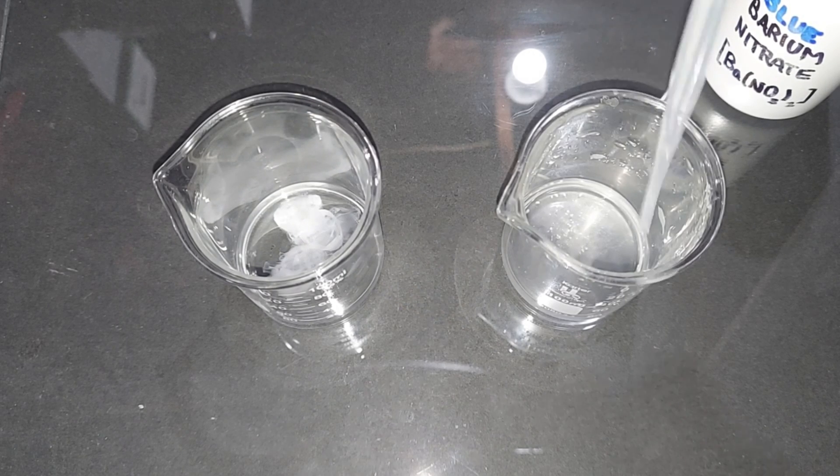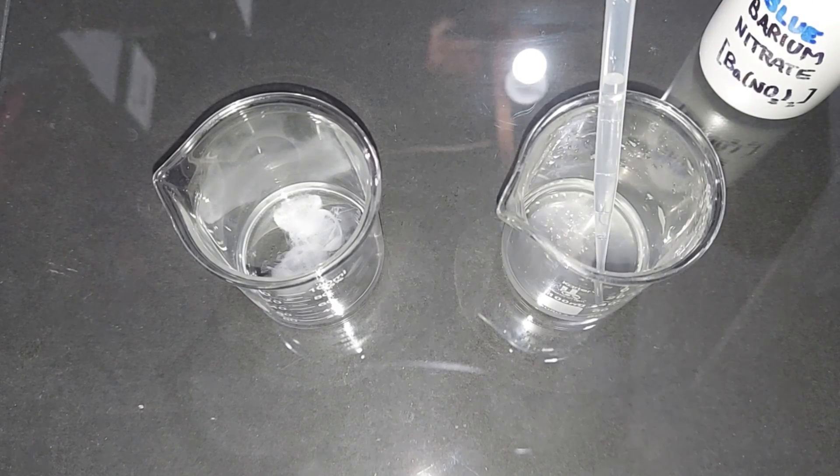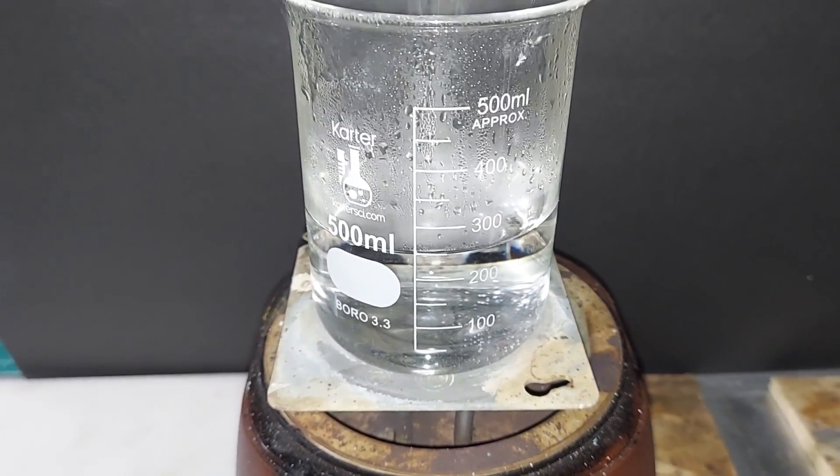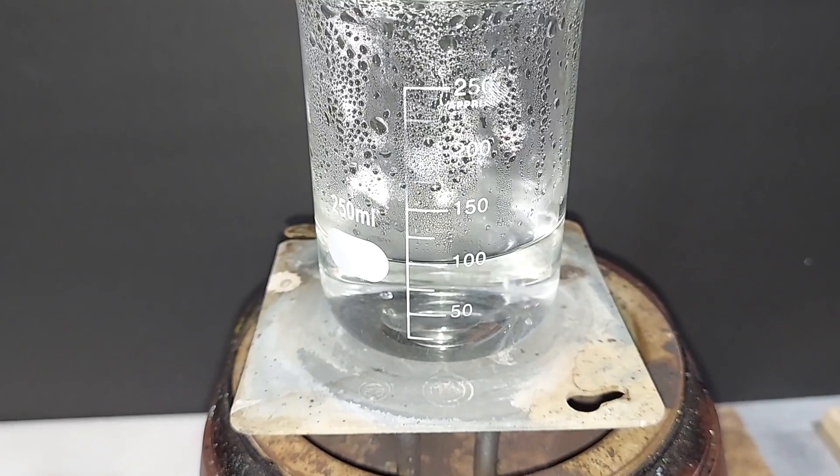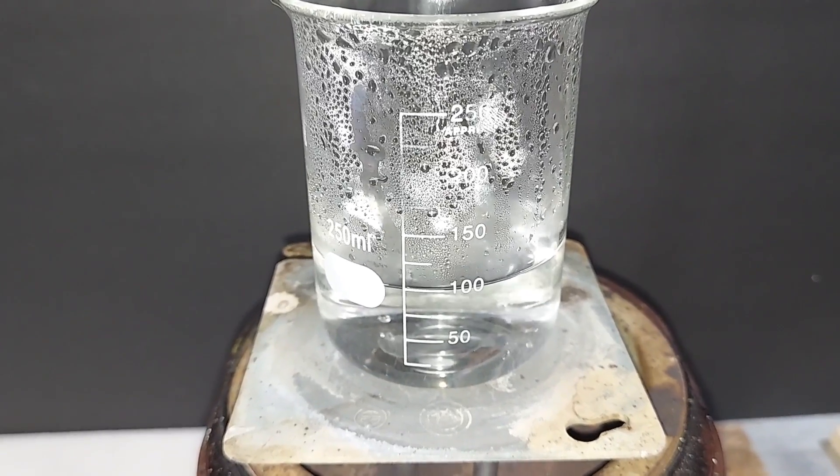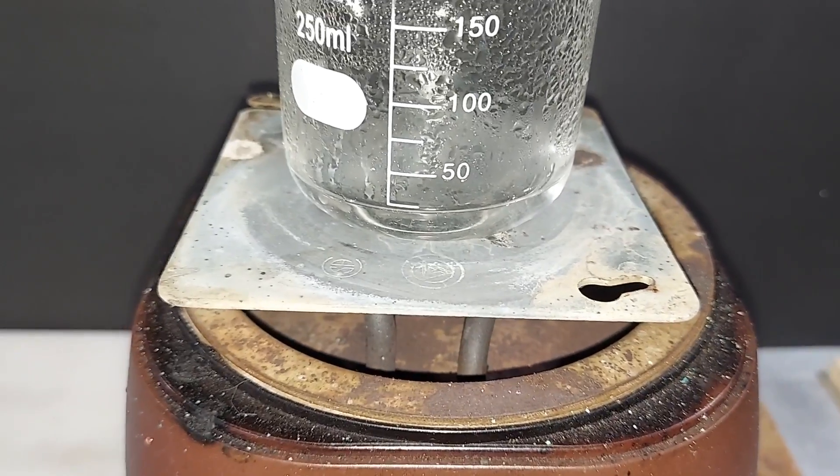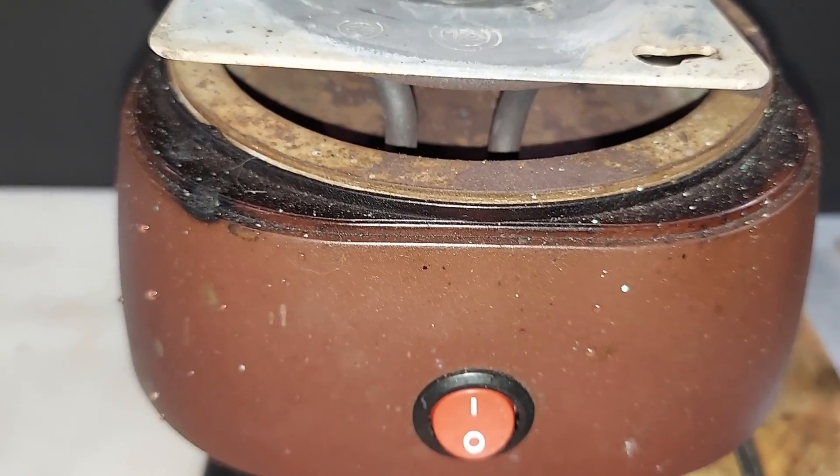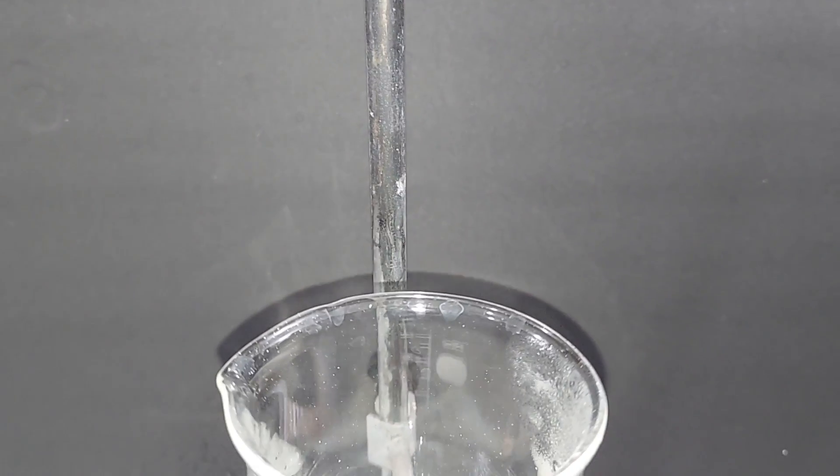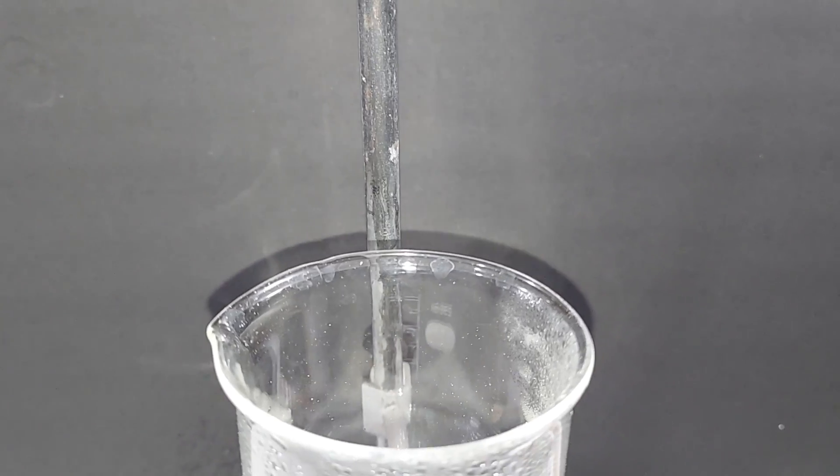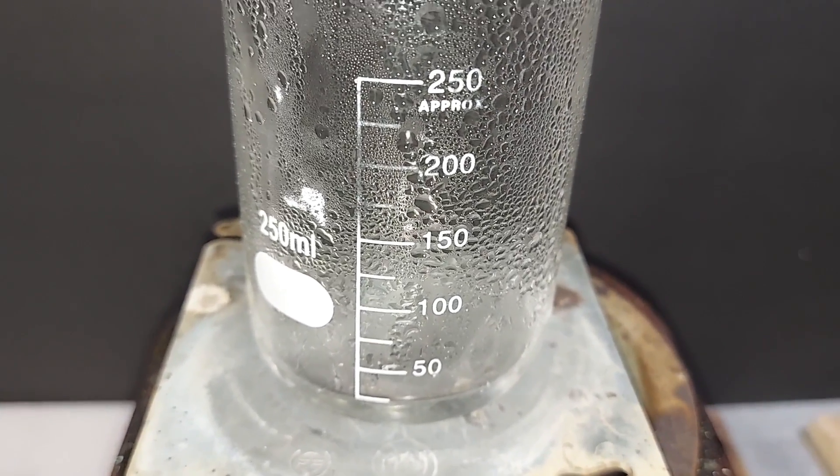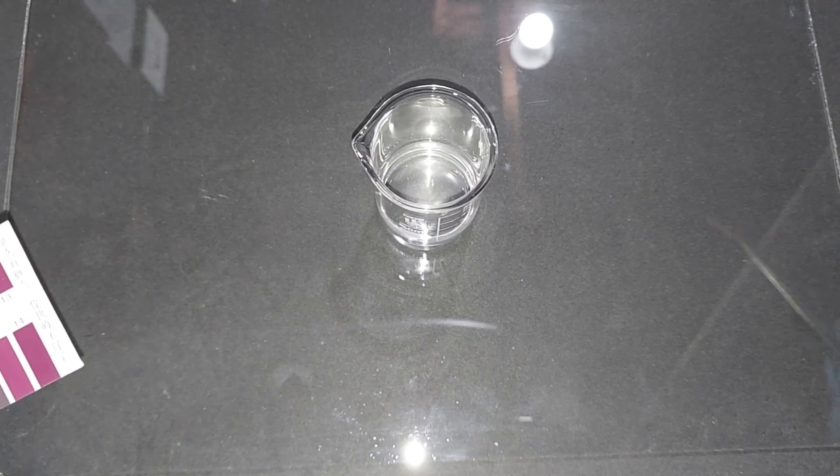Now I'm going to boil the rest down. The sulfuric acid is getting boiled down to see how concentrated it can get. It had boiled down to 100 milliliters, so I put it in a smaller beaker and it continues to boil. It's down to its last 25 milliliters, so I'm turning it off. Unfortunately, you don't see that really dense white smoke from above, so we know it's not concentrated sulfuric acid.